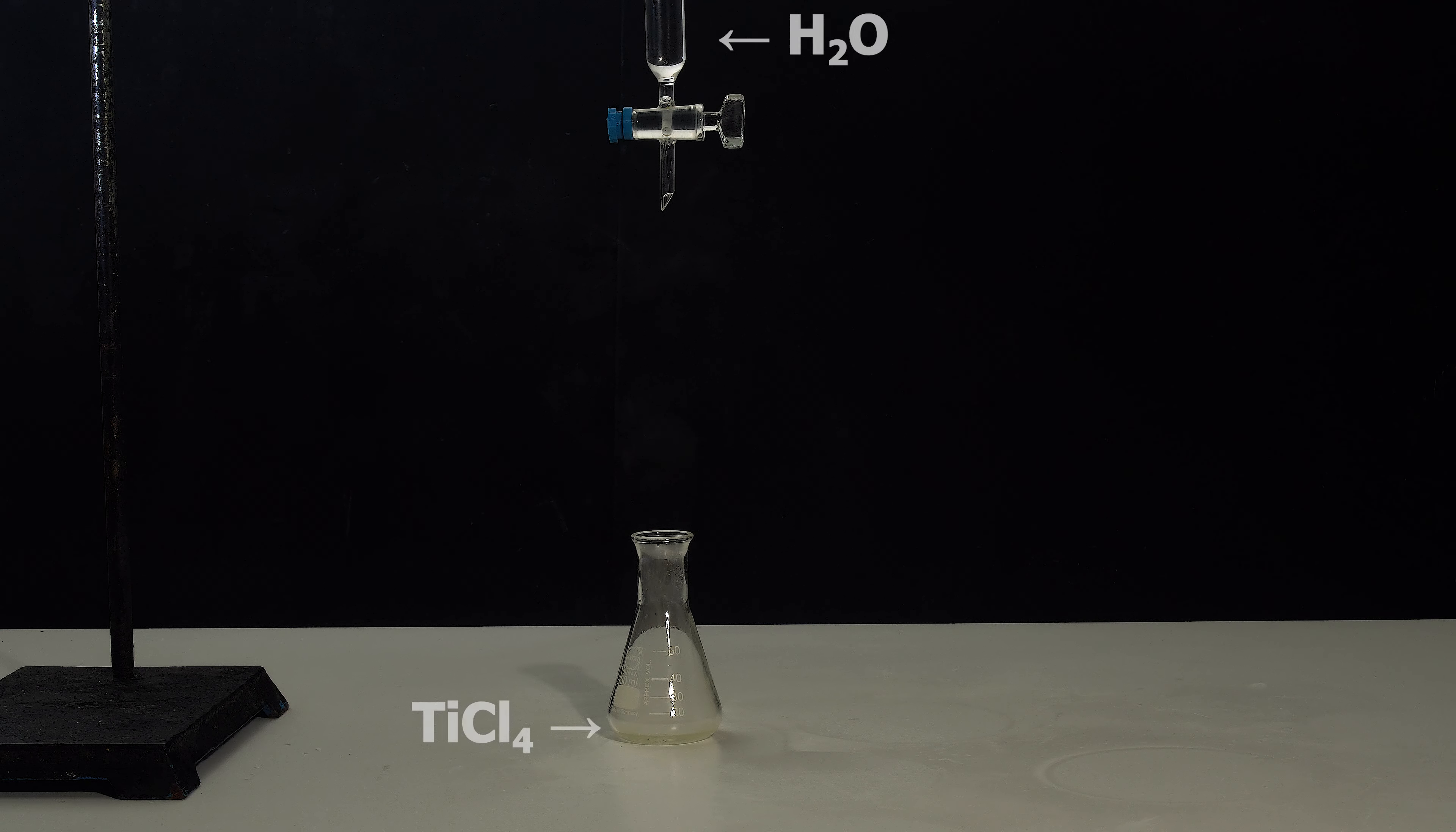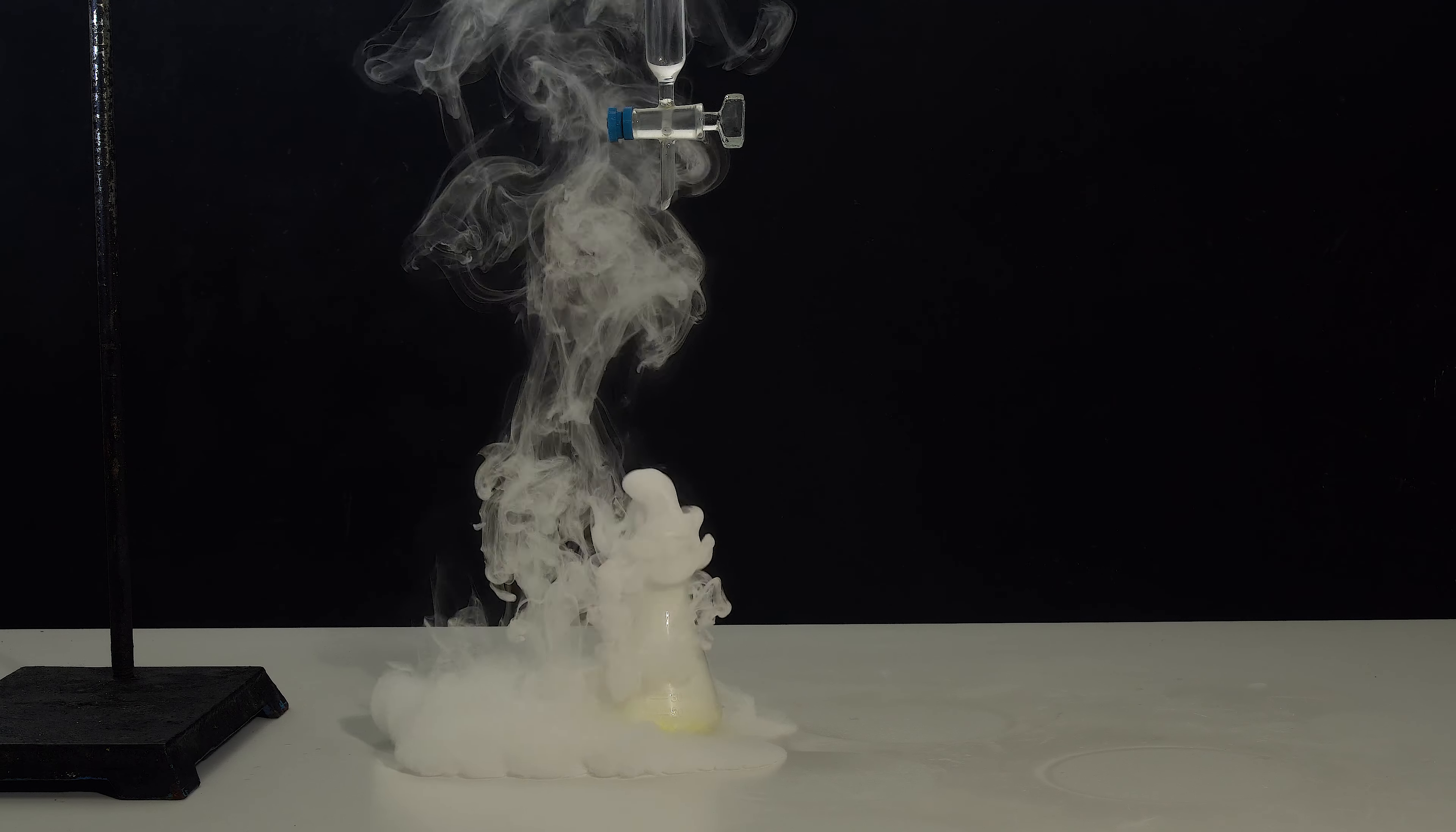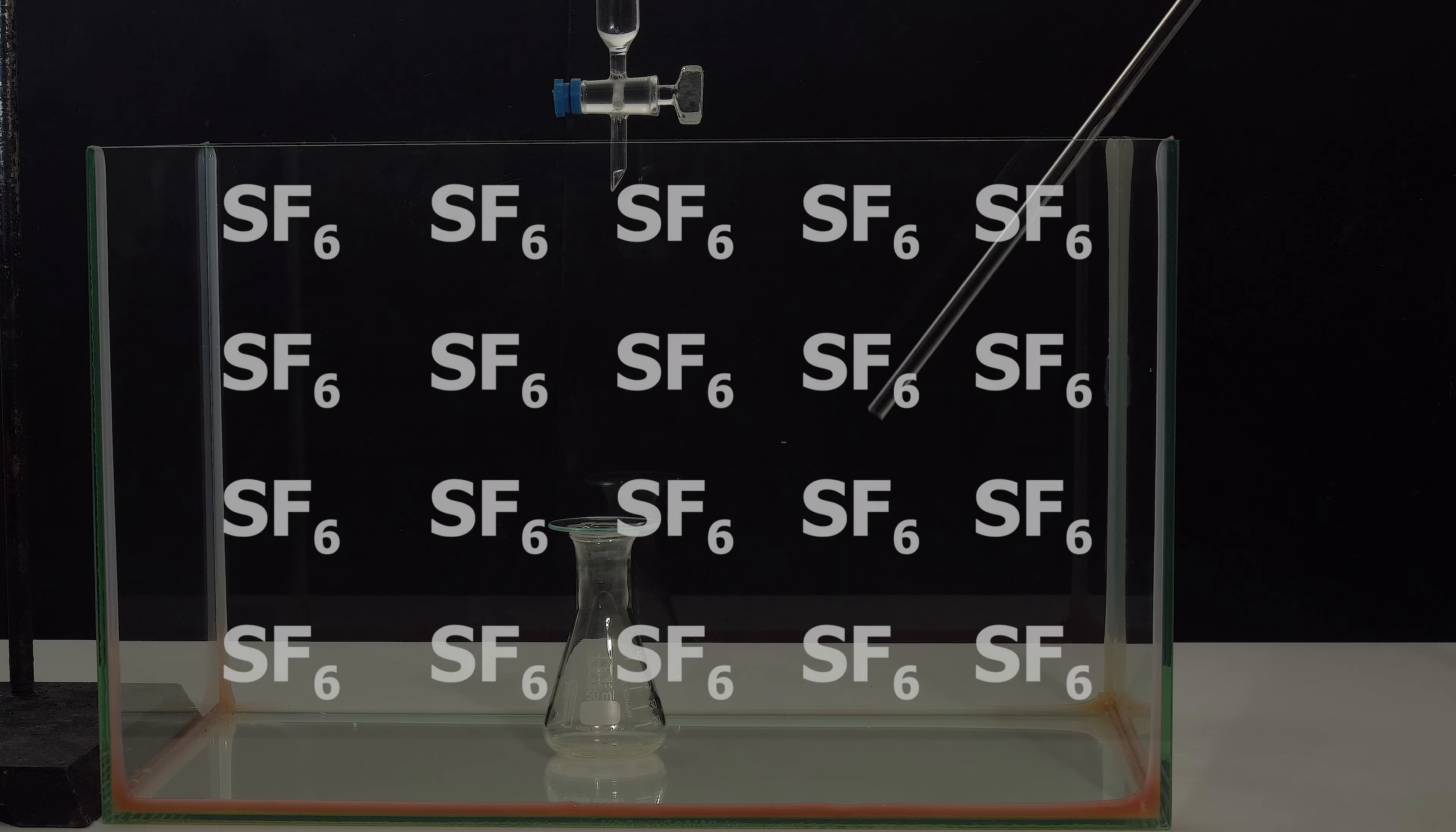When reacting with water, titanium tetrachloride produces a great amount of white smoke. So by adding water drop by drop into titanium tetrachloride in the sulfur hexafluoride atmosphere, I try to achieve something that looks like an ordinary white cloud.